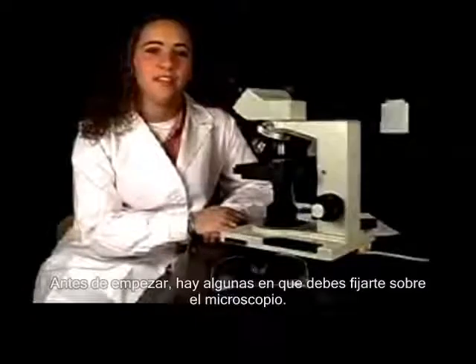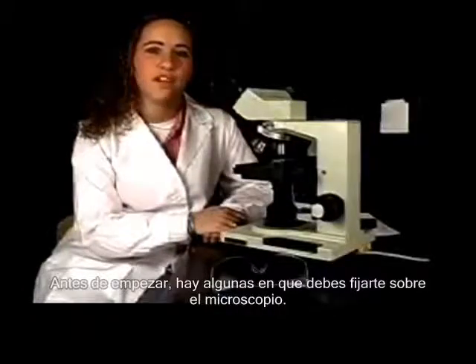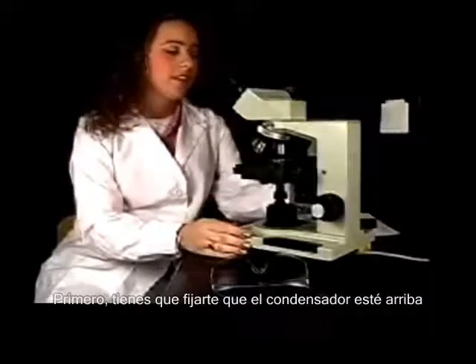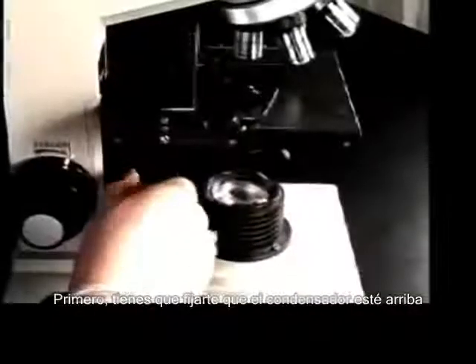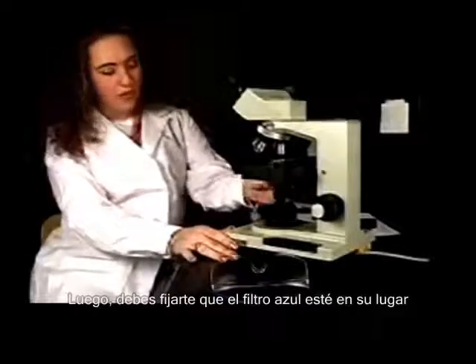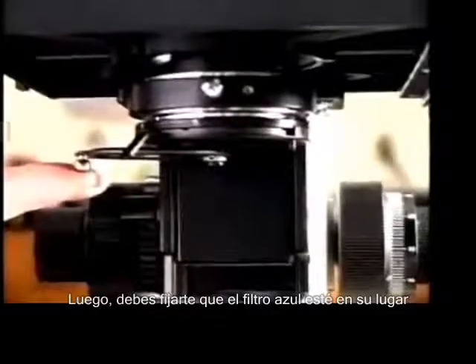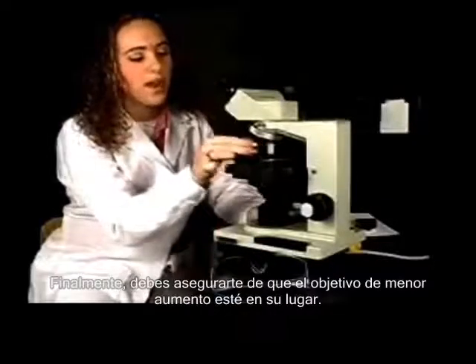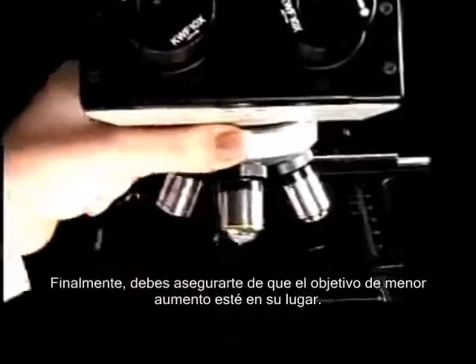Before we begin, there are a few things to take notice of on your microscope. First, you want to make sure that the condenser knob is turned all the way up. Next, you're going to make sure that your blue filter is in place. Lastly, you want to make sure that the 4x objective is in place.